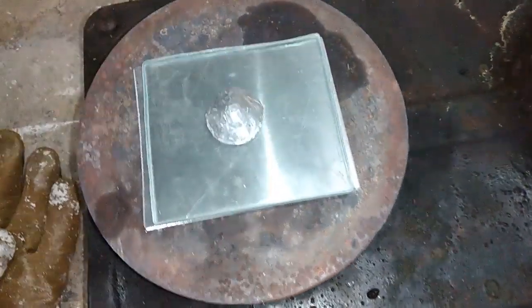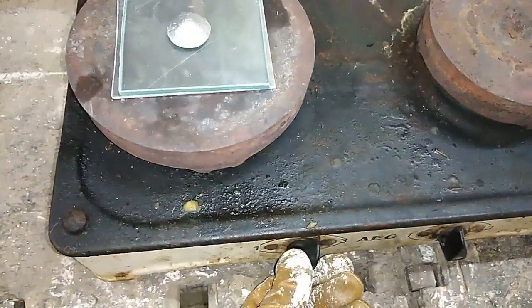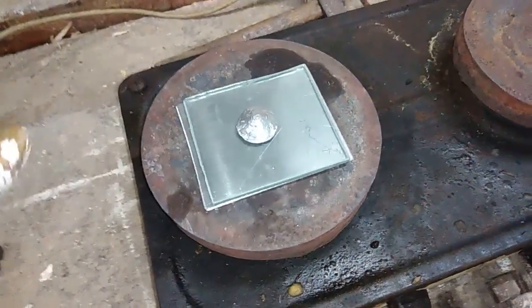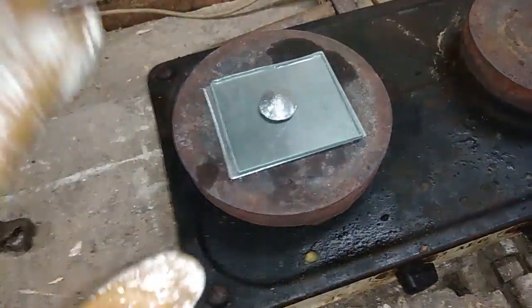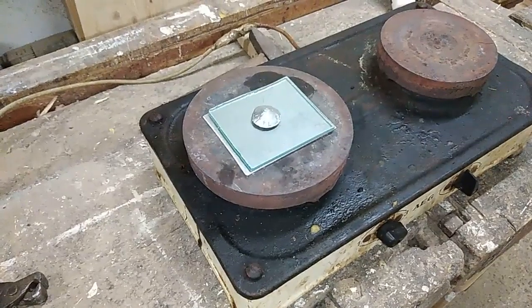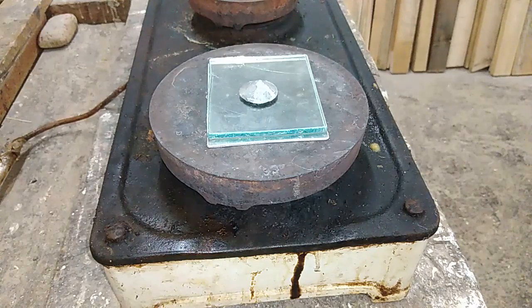Put that on the heat and try to make some indium glass. I will turn the heat on and I hope that my setup will produce enough energy to heat all the glass and not make my glass break. I will probably spill some indium, but never mind. So I put that on the low heat — just be careful with the glass, because this is not a glass which is resistant to fire. This is a normal glass, so I hope it will not break.